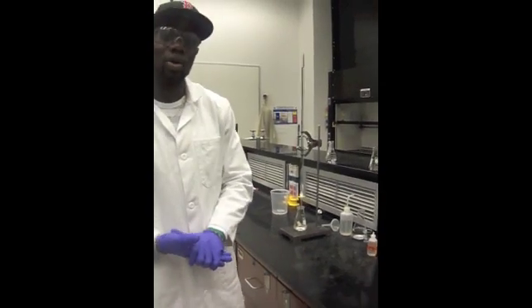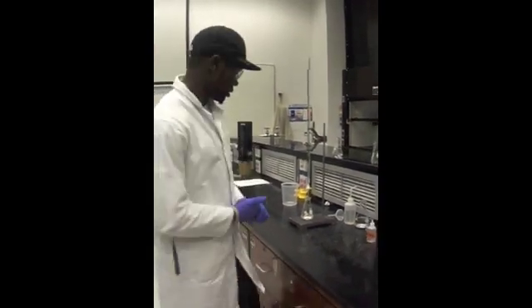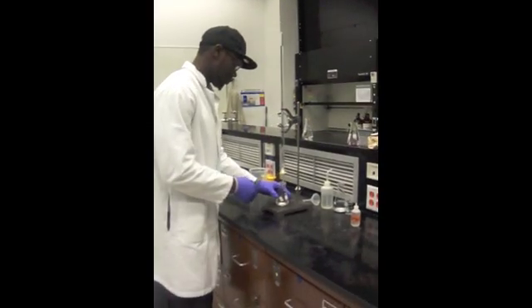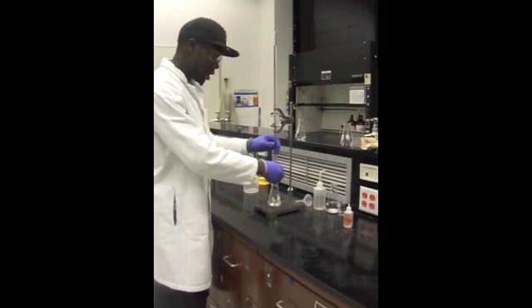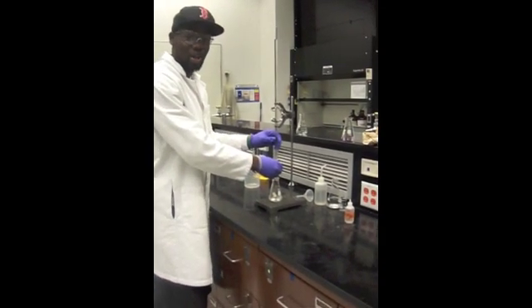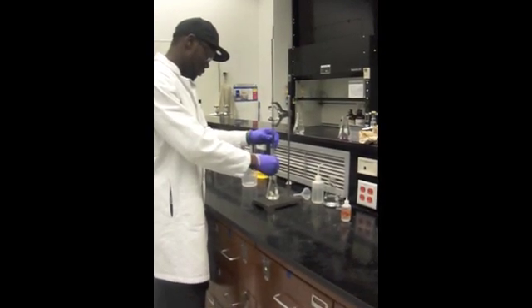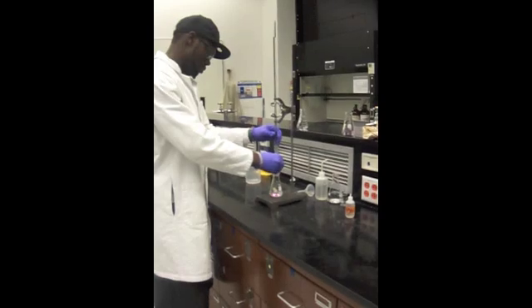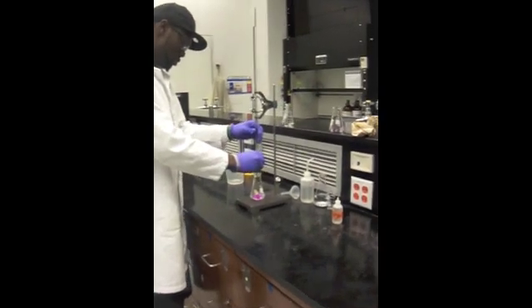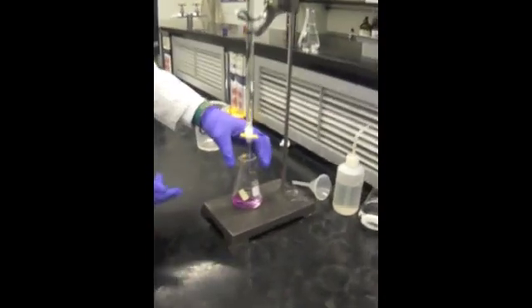Now I'm going to take you through how not to do the experiment. You want to start off by releasing the stopcock and it's going to release the sodium hydroxide into the KHP solution.